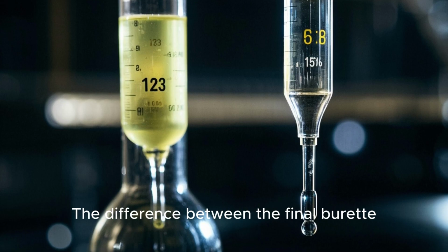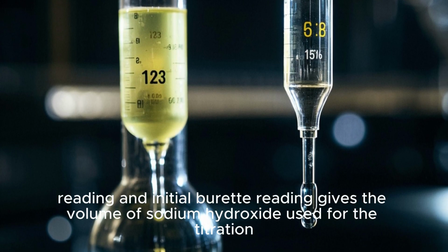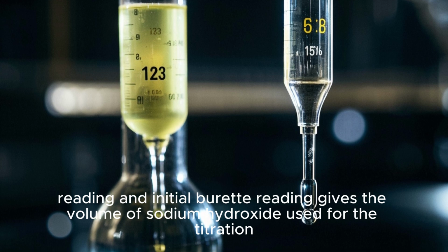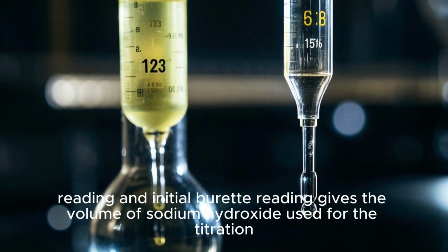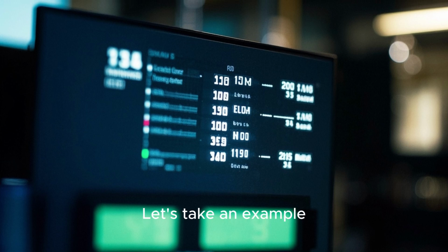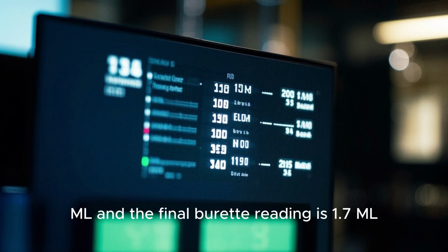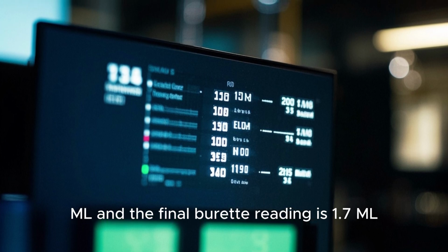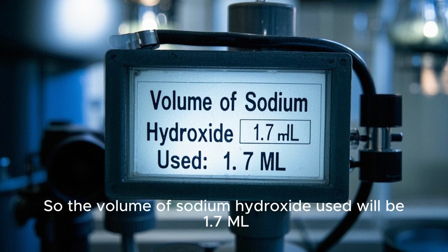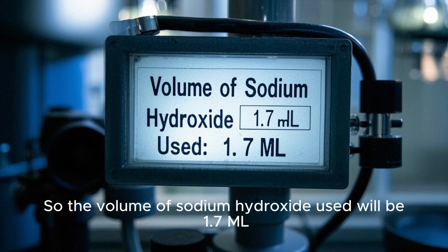The difference between the final burette reading and initial burette reading gives the volume of sodium hydroxide used for the titration. Let's take an example. Say the initial burette reading is 0 ml and the final burette reading is 1.7 ml. So the volume of sodium hydroxide used will be 1.7 ml.